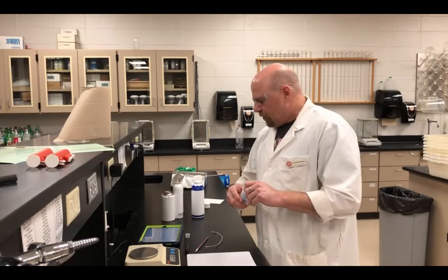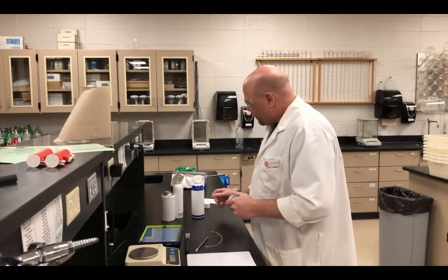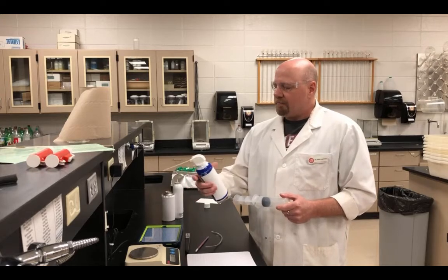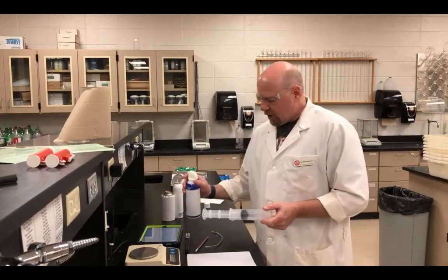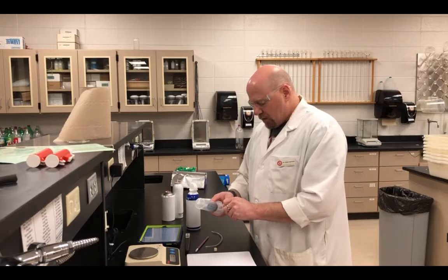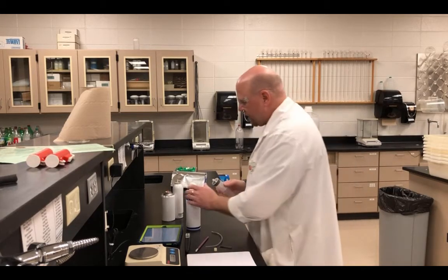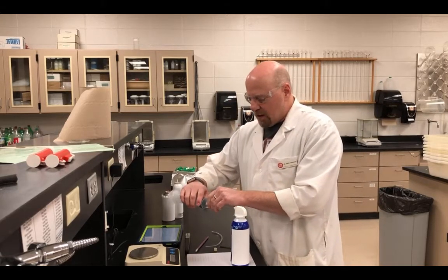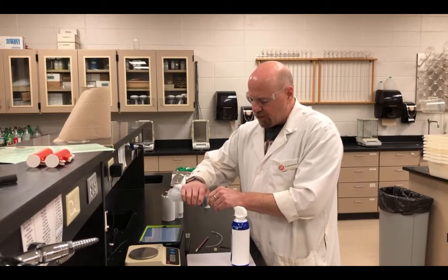Now, what we are going to do is fill the syringe with one of these gases. We'll go ahead and use this one. This is a brand of canned air, what you use to clean computers and keyboards with. Now, the way we're going to do this is I will push this all the way down, and we're going to insert the tube that we're going to spray out of into the syringe itself.